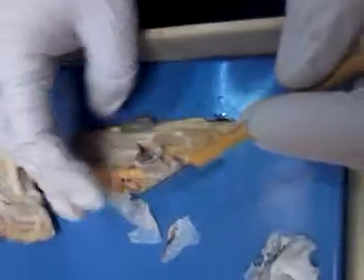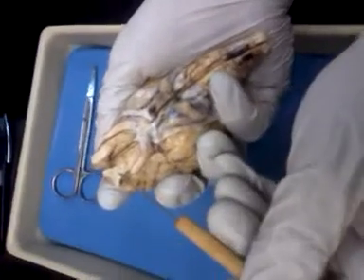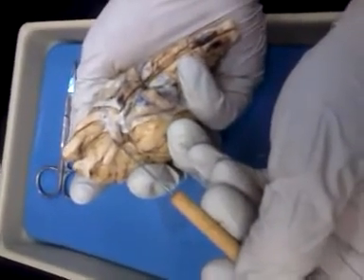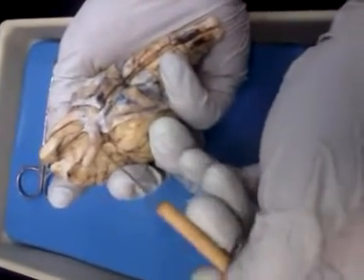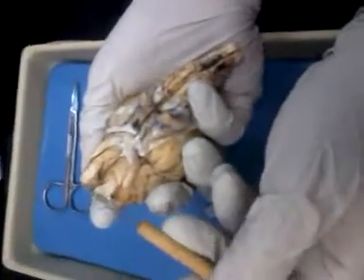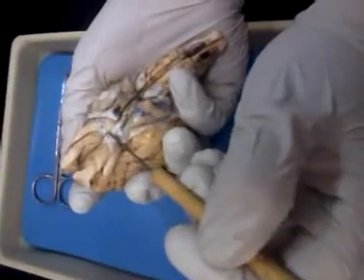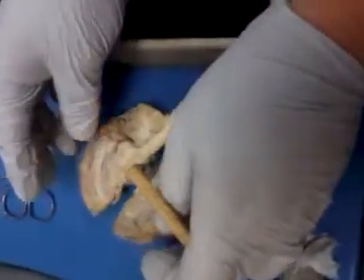Then there will be one that's together like this. You'll have to be able to label olfactory bulb and optic nerve on this one. And 1, 2, 1, 2. This one is way out front here because it's sticking up above your sinuses. It's for smell. This one is for vision because it crosses over here. Okay? Sounds like a spider's fang.